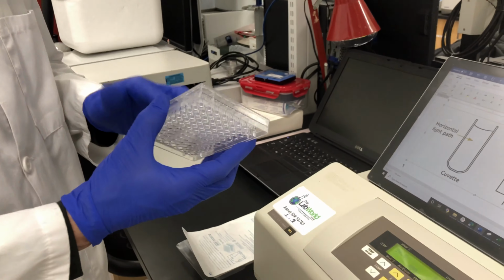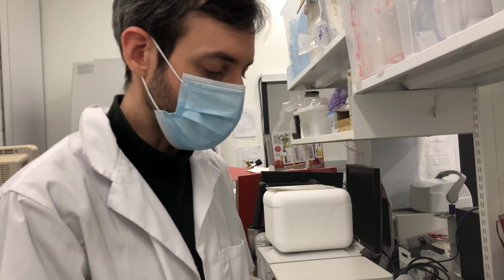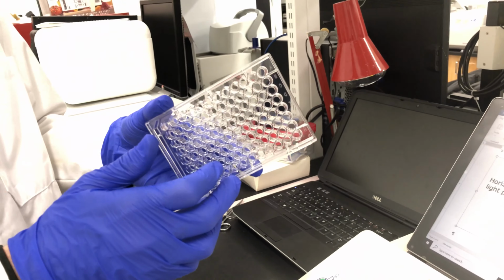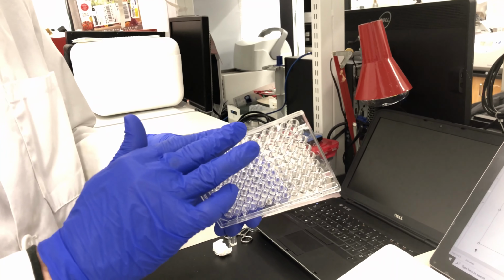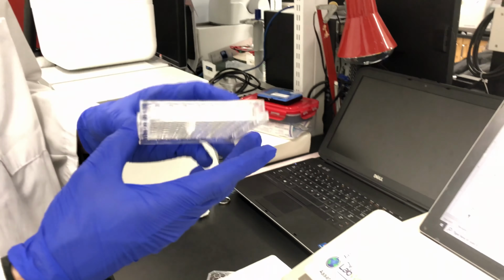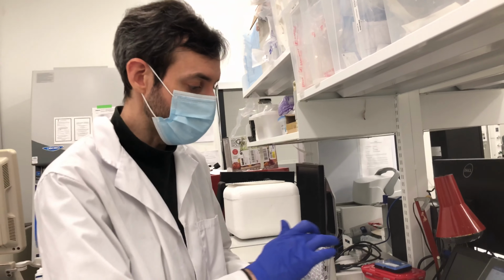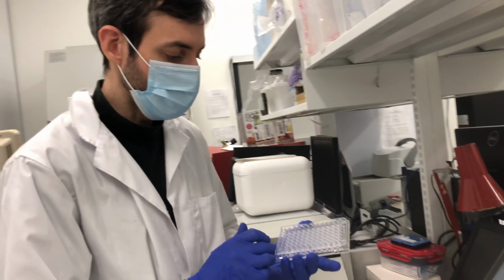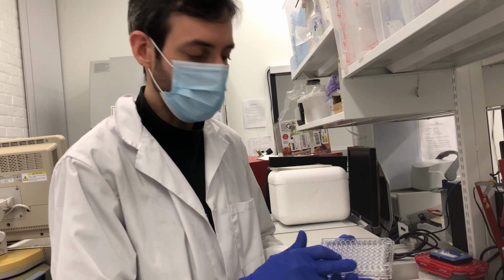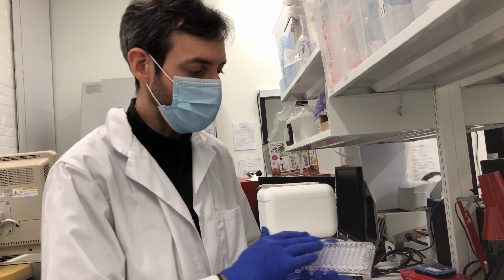Another useful thing is that when you pick your plates, there's different types out there, and just make sure that the plastic you pick isn't absorbing the wavelength that you're interested in reading. And sometimes these do have a natural tendency to absorb specific wavelengths, so always check the specifications before using them or doing your experiment. So if you're doing fluorescence, this would be black, and that's to prevent any autofluorescence coming from the plastic. If you're just using regular vis, this would be a clear plate. If you're doing luminescence, this would be a white plate.